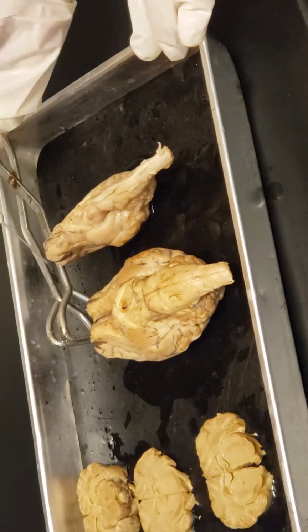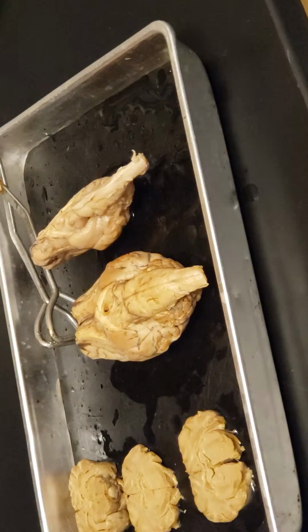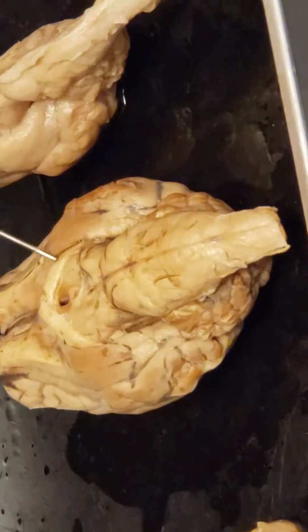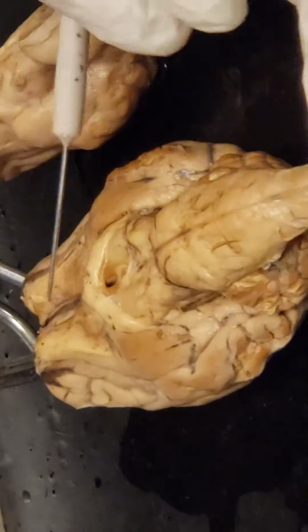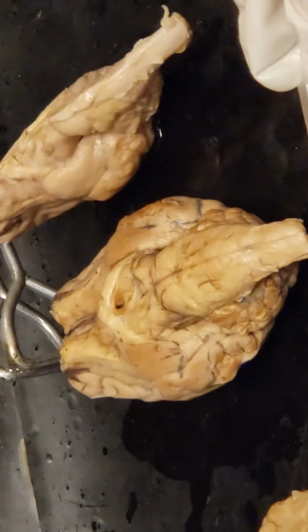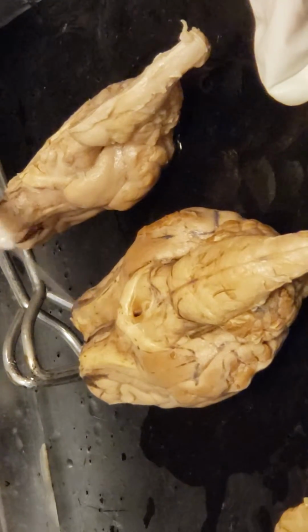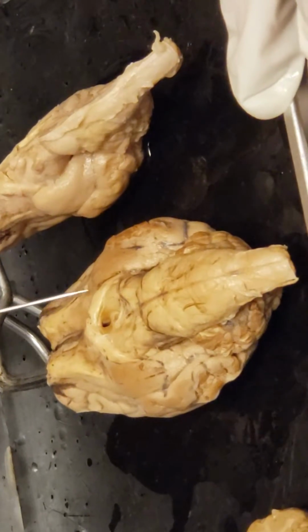Then the optic nerves. So the optic nerve that runs to the right eye is read by the left side or interpreted by the left side of the brain, and vice versa. So they have to cross. So these are the optic tracts because we're in the central nervous system. So this is one and this is the other, and they're moving, and this is where the eye would sit. So this one's going this way and this one's going this way, but it's been cut at what is called the chiasm, which is the intersection between the two. This is the optic chiasm in between, and then the two optic tracts on either side.